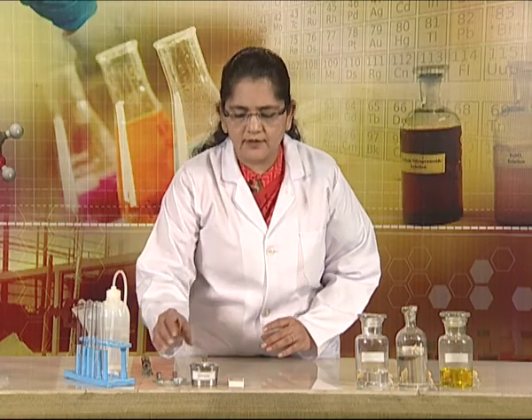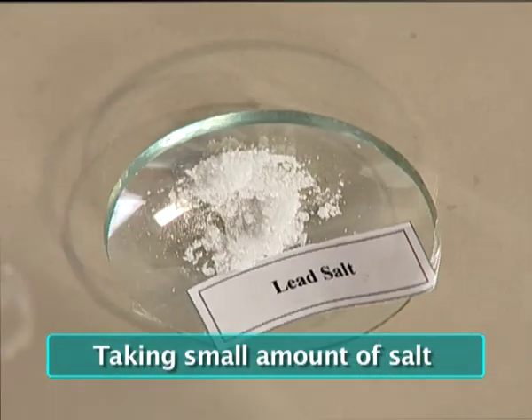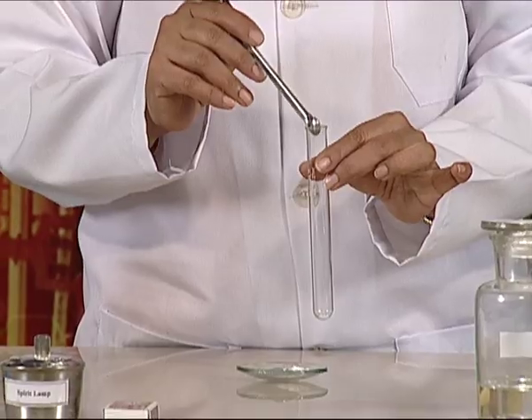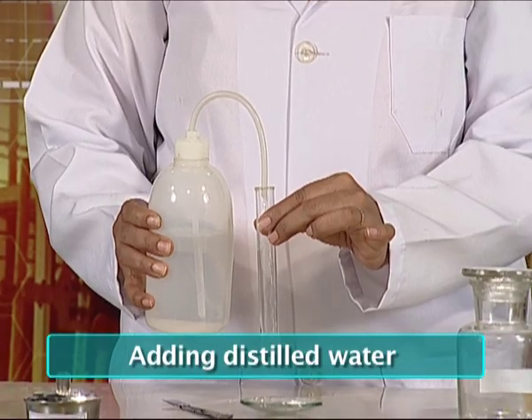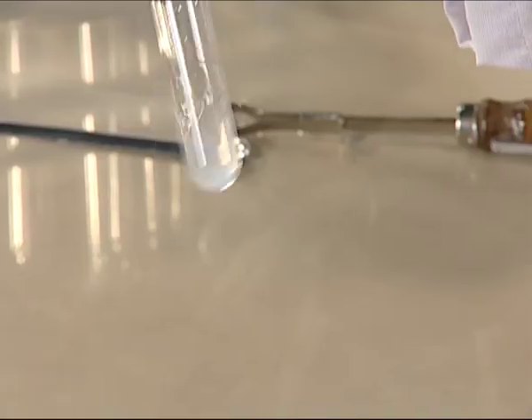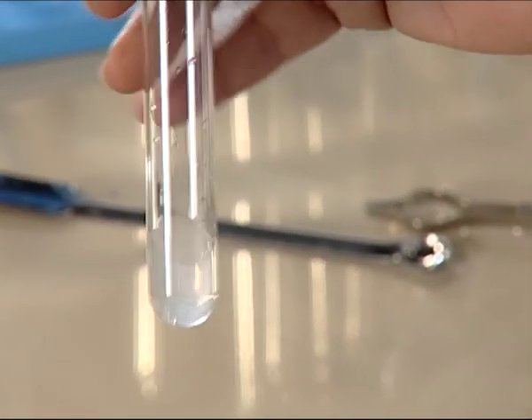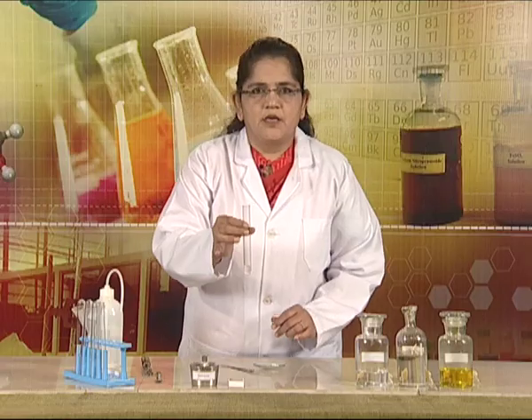For this, we take a small amount of salt in a test tube and dissolve it in water. Here, we are dissolving in cold water, but in case the salt does not get dissolved, then you can heat it and dissolve it in warm or hot water.